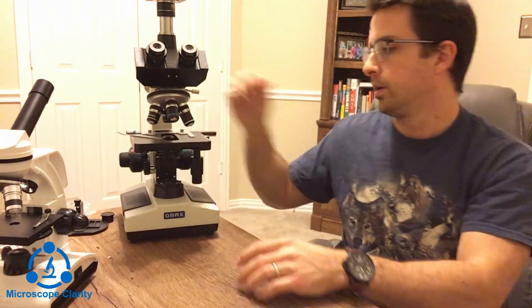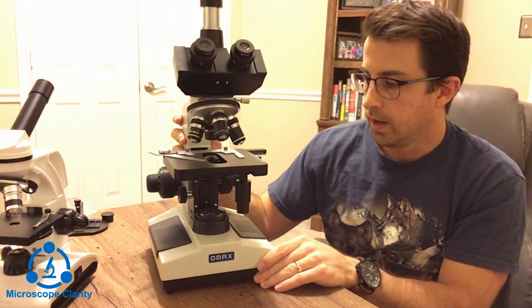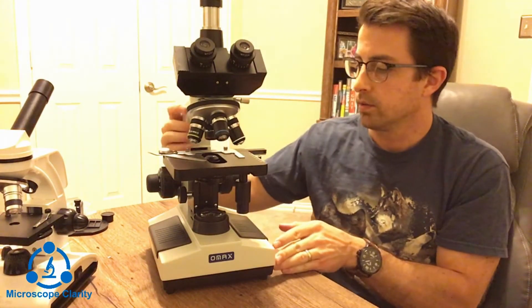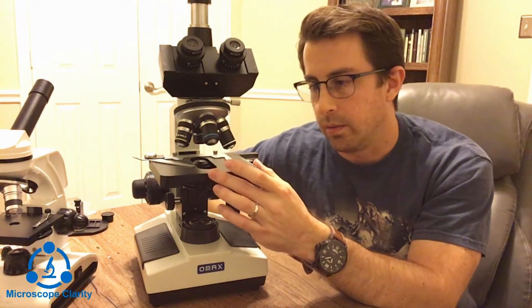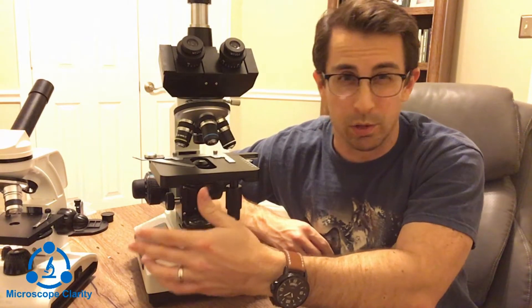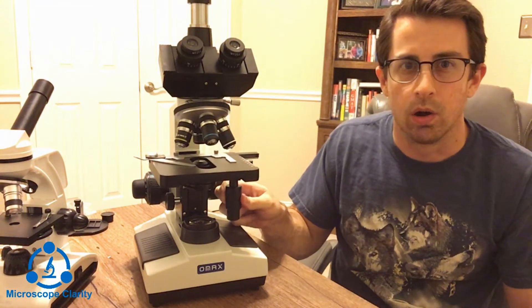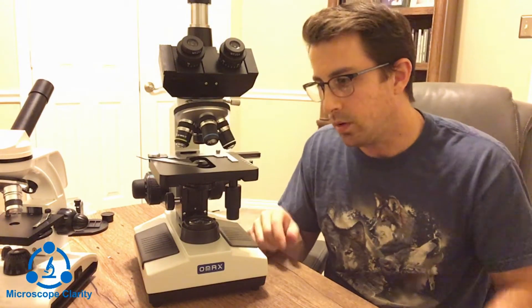Now let's switch over to the larger, more complex compound microscope. Starting at the bottom, this one also has an illuminator — it's not plugged in right now — and also an intensity adjustment knob. On the sides it has the same coarse and fine focus knobs. A key feature here is the mechanical stage, which allows you to maneuver the slide without physically touching it. The XY translational knobs move the slide along the x and y axes on the stage.